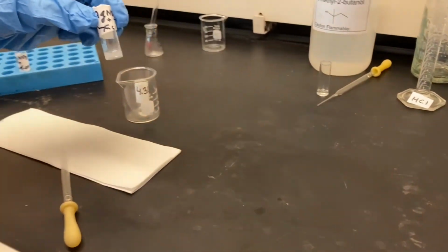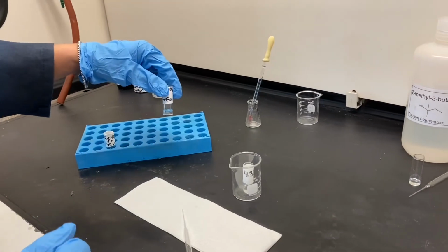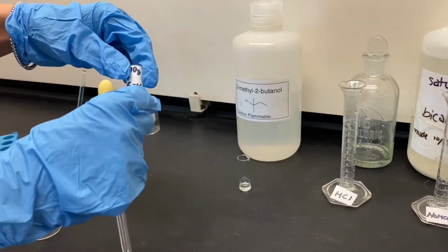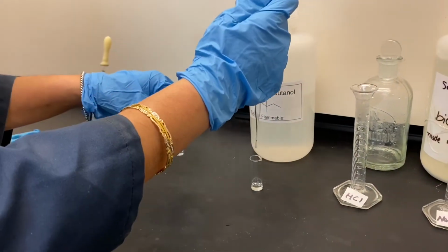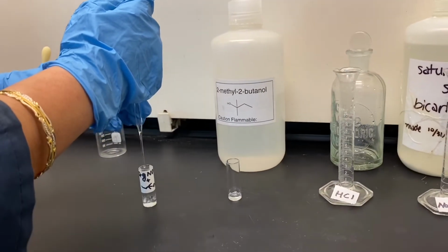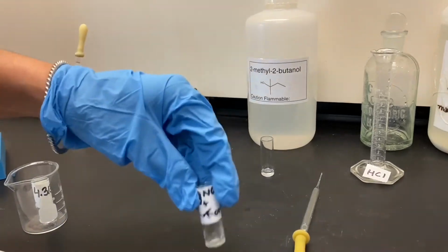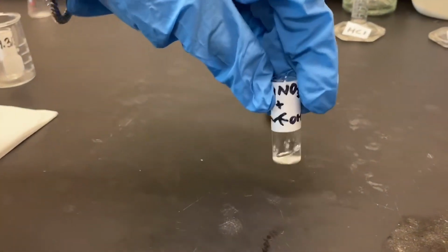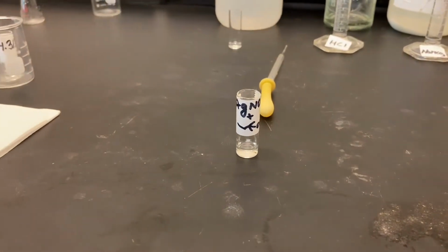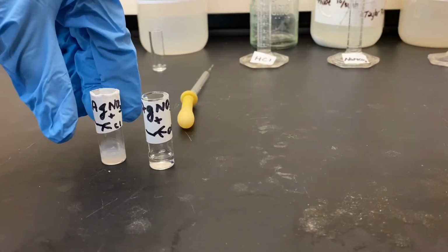Remember to avoid skin contact with silver nitrate because it becomes reduced and turns black-brown. Now for comparison, I'm adding about 4 drops of our starting butanol to this other vial of AgNO3 solution, and on shaking it, I do not visually see any changes to this solution mixture. So if we compare both of them by placing them next to each other, we clearly see the difference.